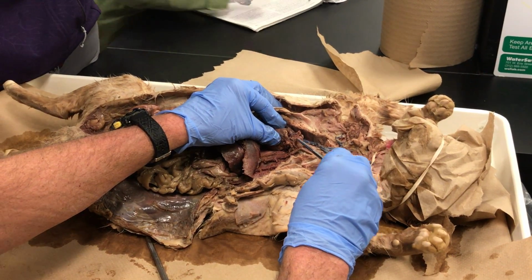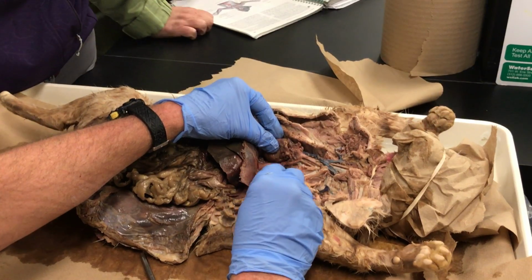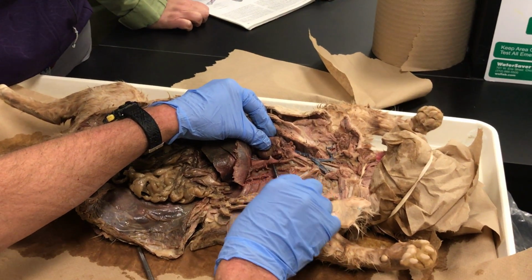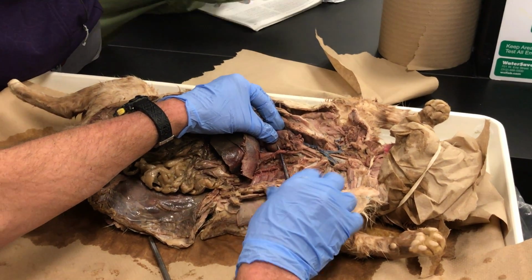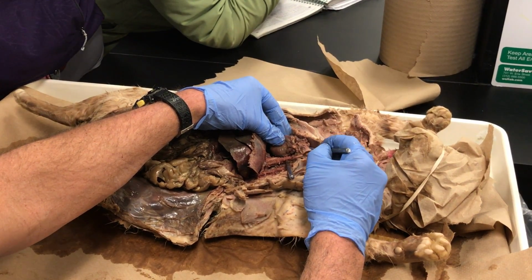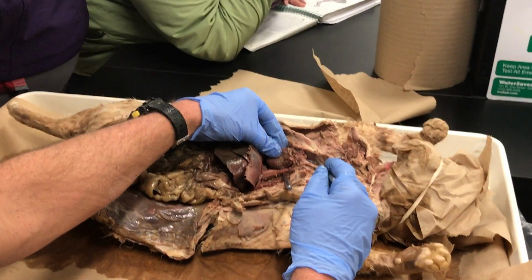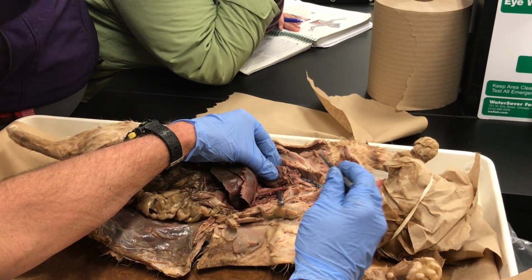It doesn't ascend very far. Remember the heart, it forms like a U-turn really quickly, and then all of this is aorta that's in the chest. So that would be called the thoracic or the descending aorta right there. So the aorta itself is just this pipe right here. That's it. On our hearts, we have 3 tubes that originate off the aorta. The cat only has 2. The plumbing's a little bit different.